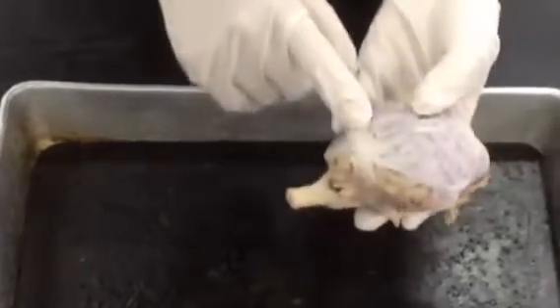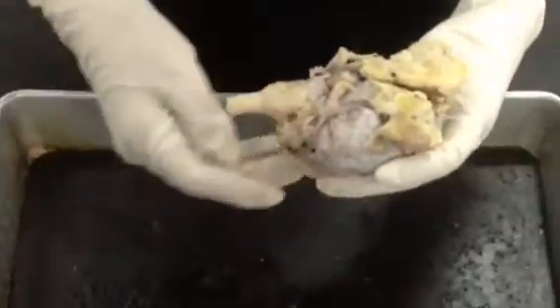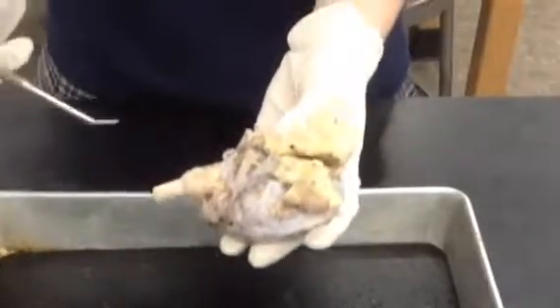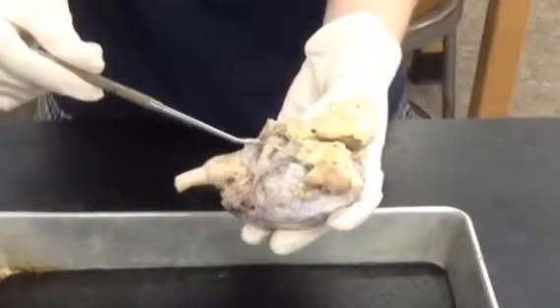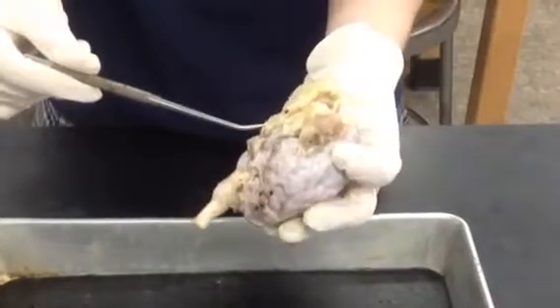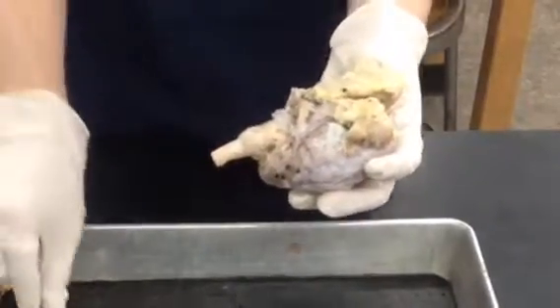Before we cut away, I want to look at the inferior side of the brain and point out the pituitary gland, which can be difficult to see after cutting away the dura mater. The pituitary gland is attached to the hypothalamus, and it is known as the master gland, and it controls the timing and amount of hormone secretions by other endocrine glands. Alright, now we are going to go ahead and cut off the dura mater as well as the fatty tissue here.